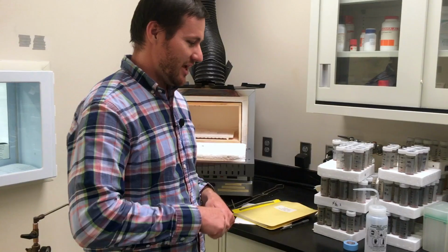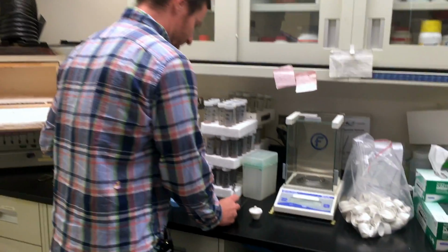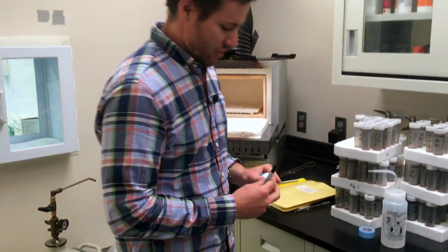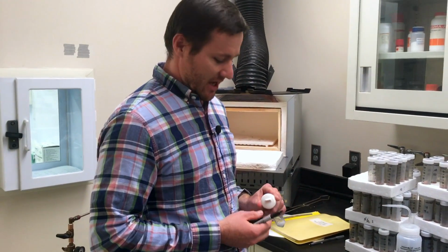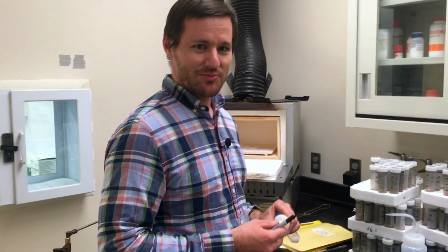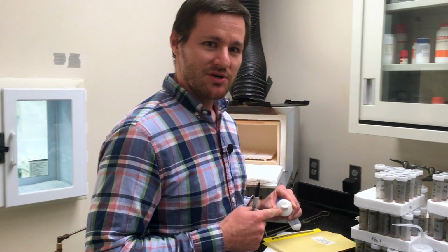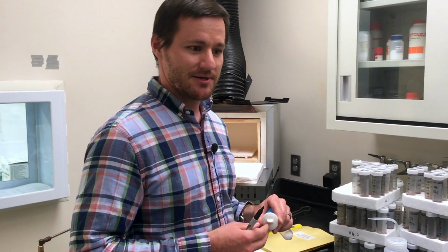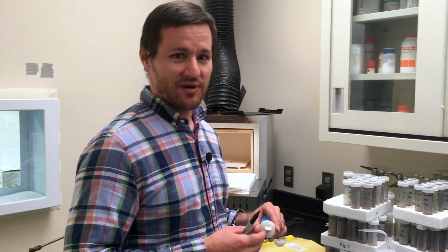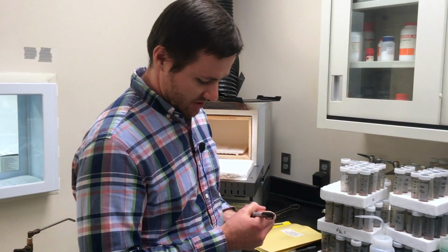It's also important when you're putting your samples in the asher to know which samples are which, and so to annotate that, we will actually mark directly on the crucible. Important thing to know is when you make your mark on the crucible, after you've baked your crucible in the oven, that marking will no longer be there when it comes out. More than likely it'll be gone. And so in addition to marking on the crucible what the sample is, you also want to make a note, as I do inside of my lab notebook, of where in the asher my samples sit. And so for instance here, we'll say S1, we'll call that sample 1.